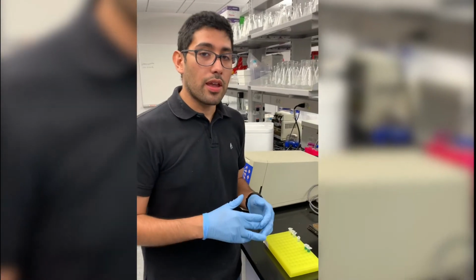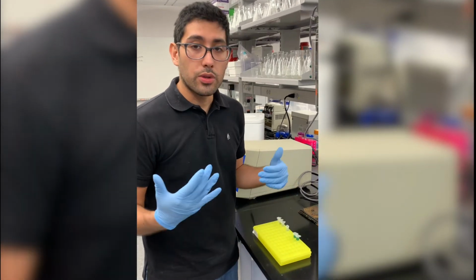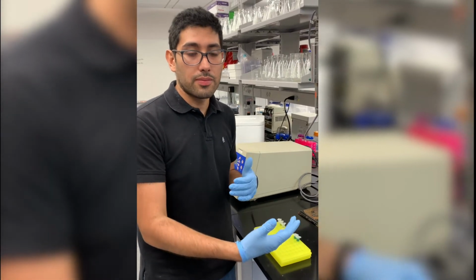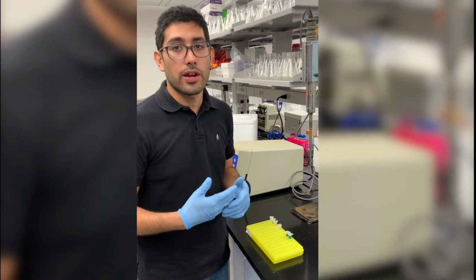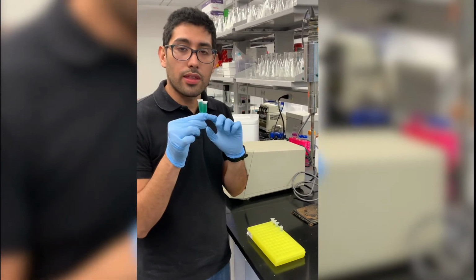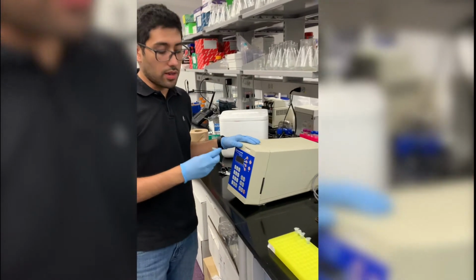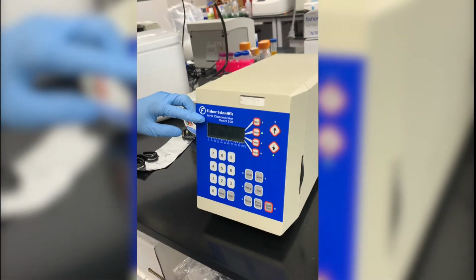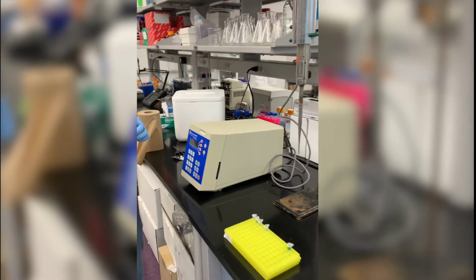Okay, so after we grow the algae to the concentration that we need, we lyse the cells open, because we need to get the materials that are inside of the cell. You can do it either chemically or mechanically. Today we are going to do it mechanically. So you take some of your liquid and then you use a sonic dismembrator. With the sonic dismembrator, you will be able to use sound waves to disrupt the cell and to be able to get whatever is inside.